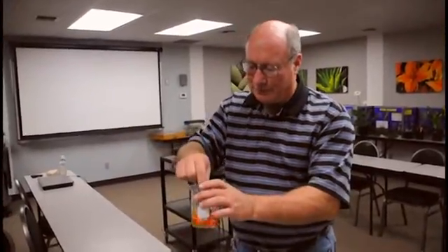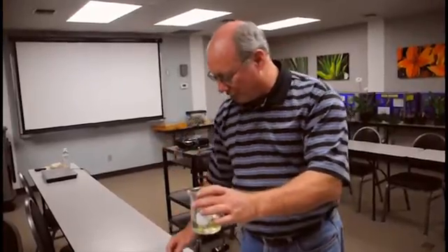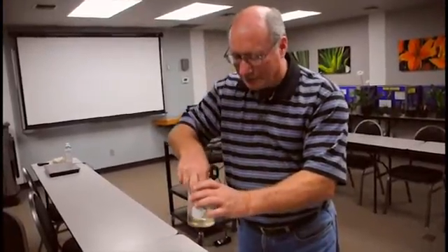Once you're done, once that sample's done, you can tip it off a little bit, make sure the solution's off. And we'll take out the rose sample too.